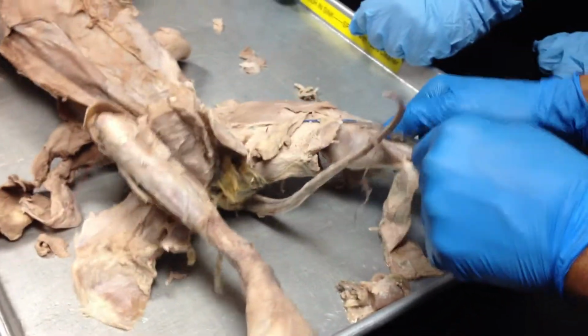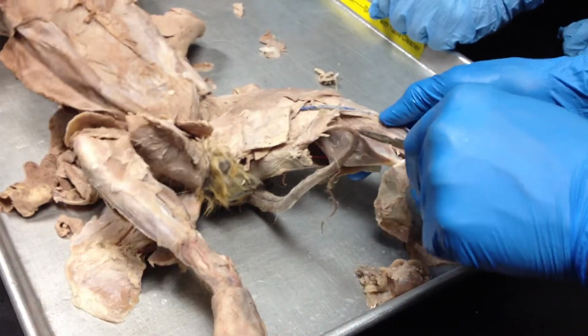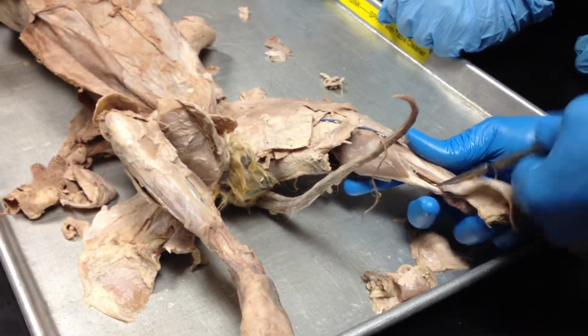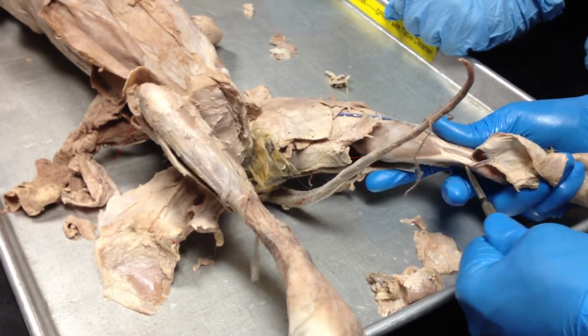We have muscles of the back. So the gastrocnemius, we can see it outermost. Right below it here is another muscle. So these two, you can see they continue. Those who wanted to see a tendon, this would be a tendon here. Okay, it's called the Achilles tendon.